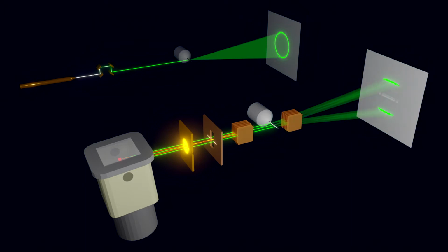This will reduce asymmetry a lot, but there is still some curvature left, and we will not be able to eliminate asymmetry completely at low angles, where the radius of the rings is small and the curvature is strong. But this is a typical configuration we can create in Profex for a capillary setup without a focusing mirror.